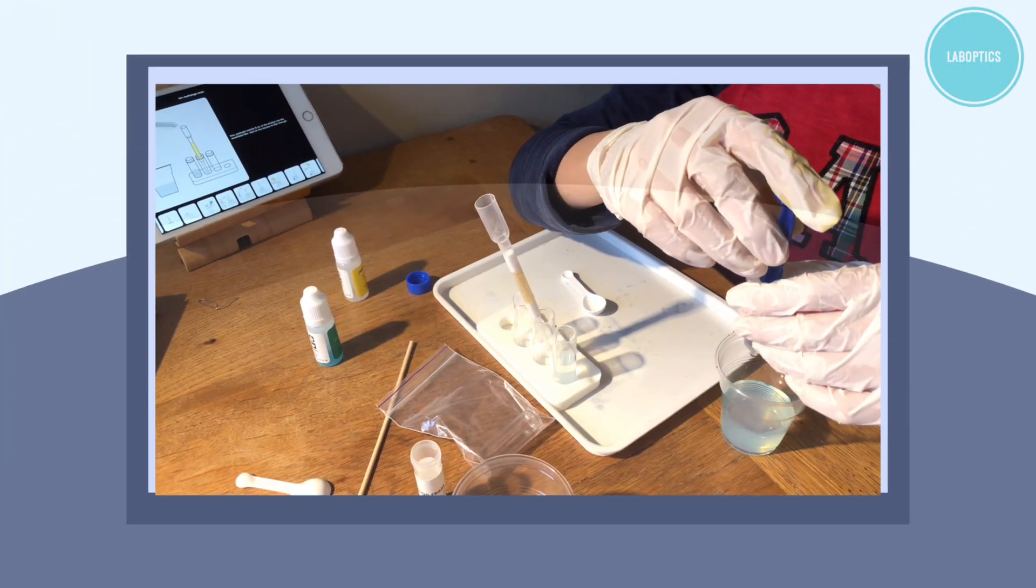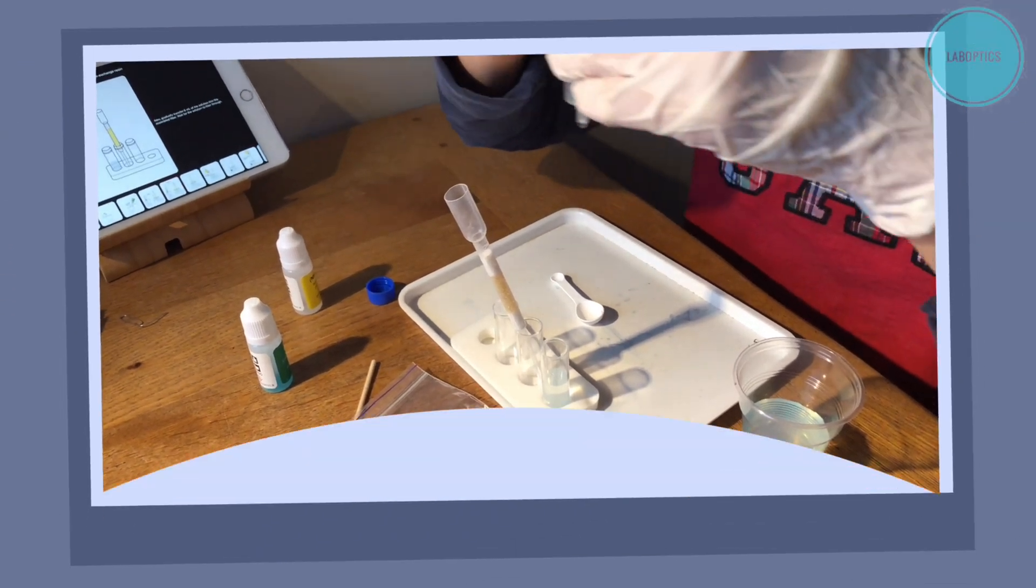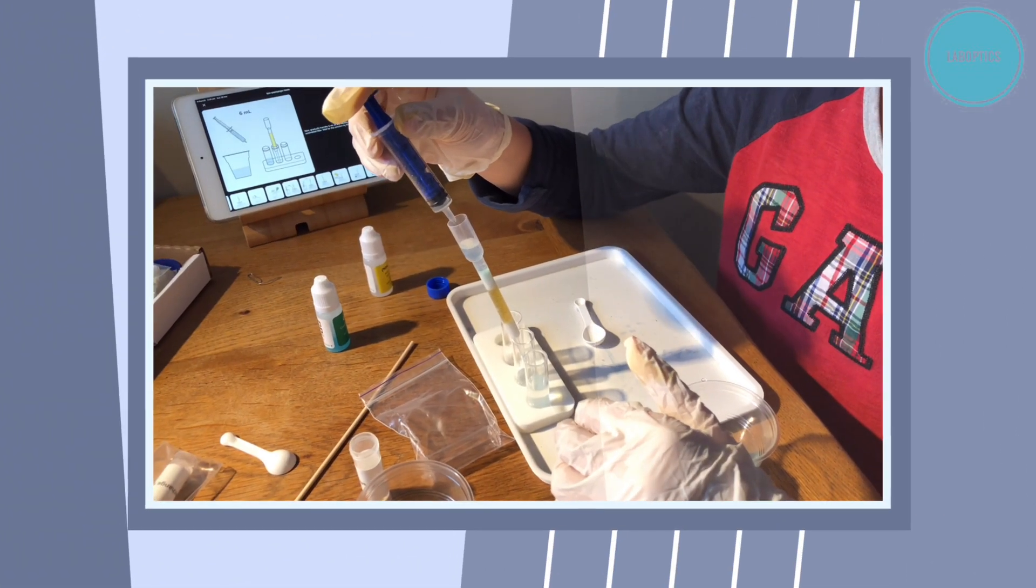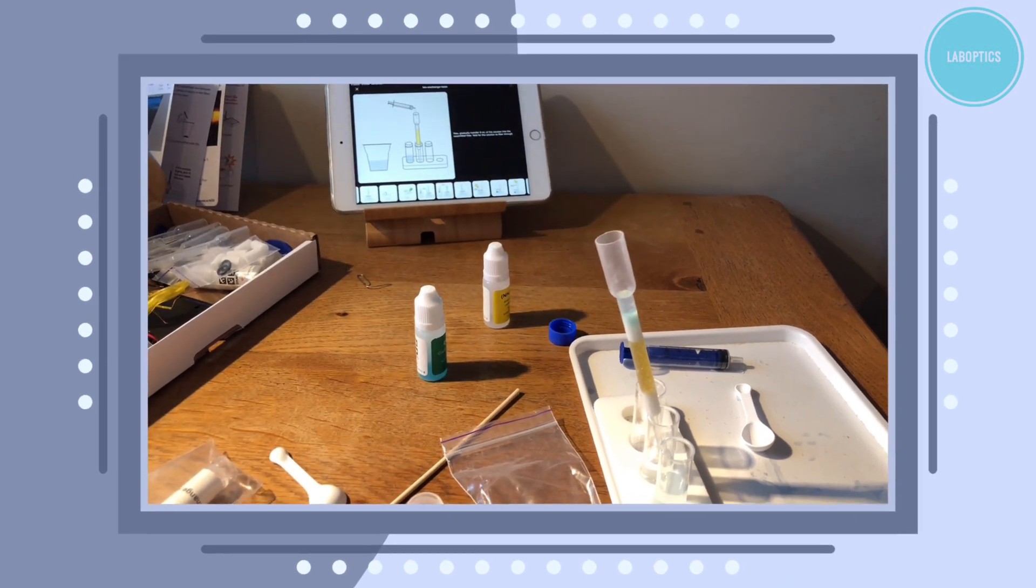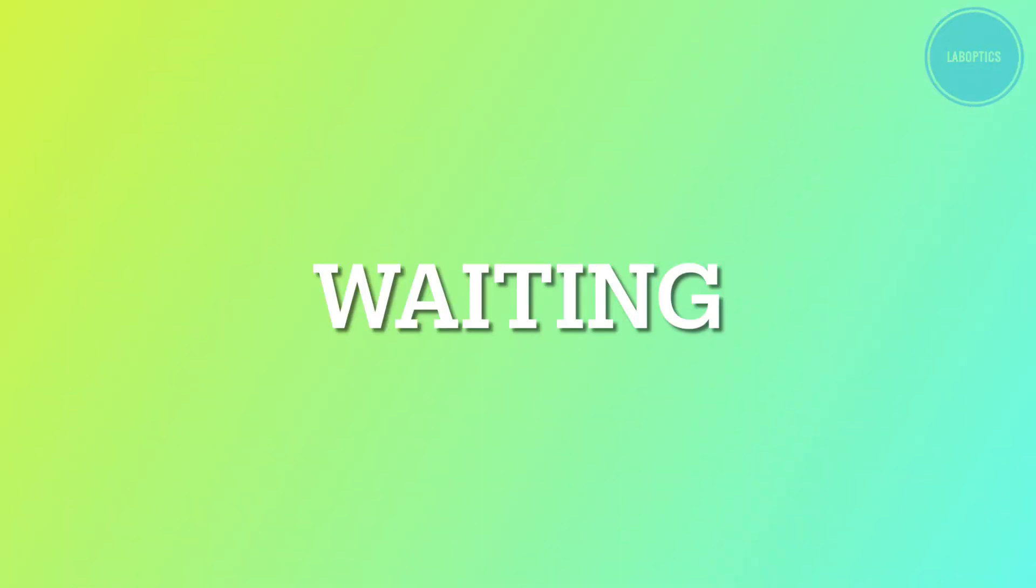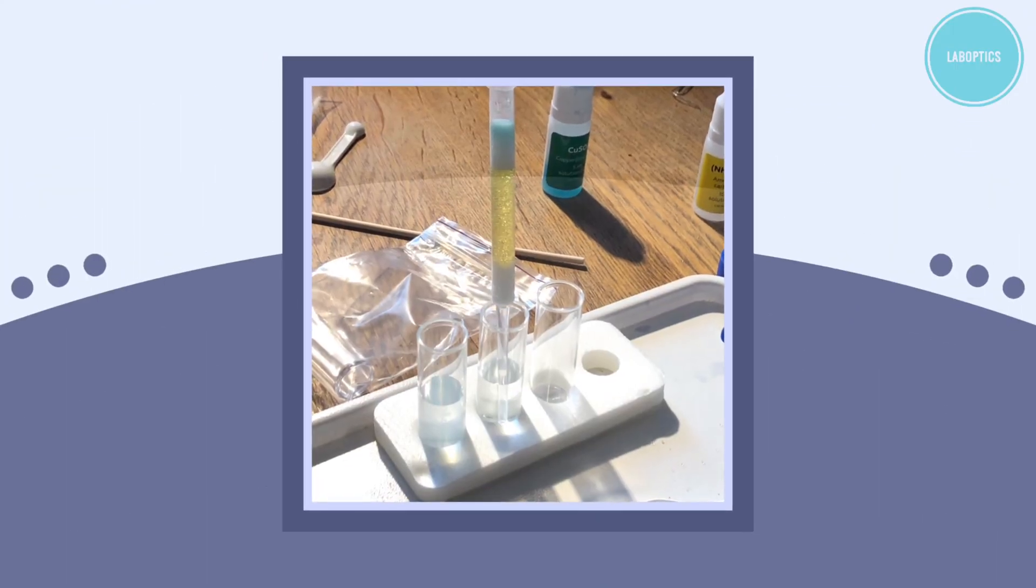And after this we will gradually transfer 6 millilitres of the same solution into our assembled filter, which is the cut pipette. We will now wait for the solution to filter through.